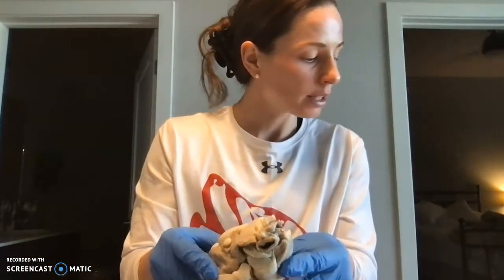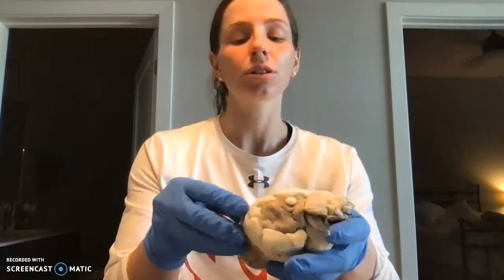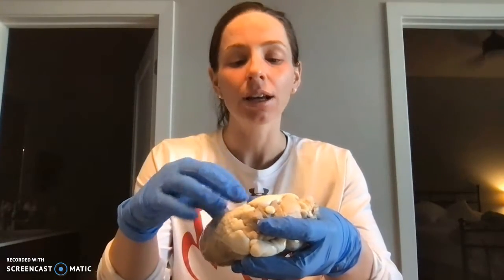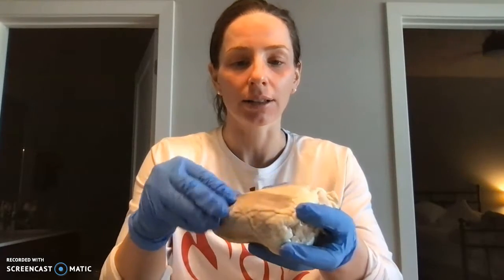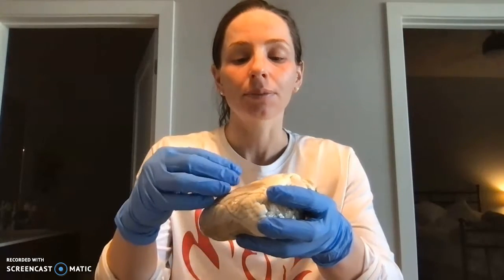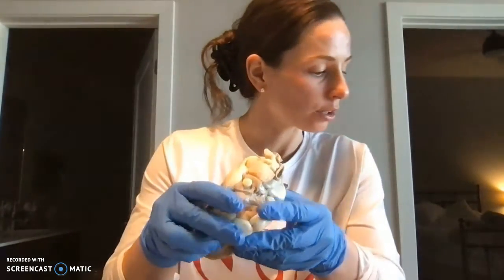side of the heart. And then if we talk about layers of the heart, I mentioned the muscle layer is the myocardium. Then we have the endocardium, which is that inner layer, and the pericardium is the top layer, that shiny layer that protects the heart. The pericardium is that outer surface. The myocardium is the muscle tissue itself, and then the endocardium actually makes up the tissues of all of the vessels of this heart.